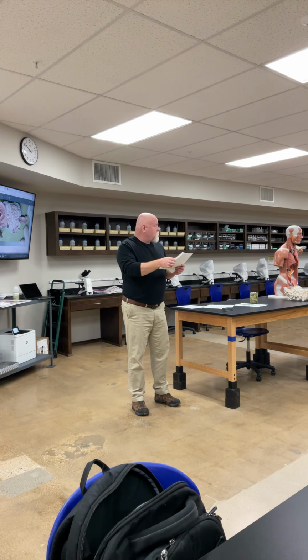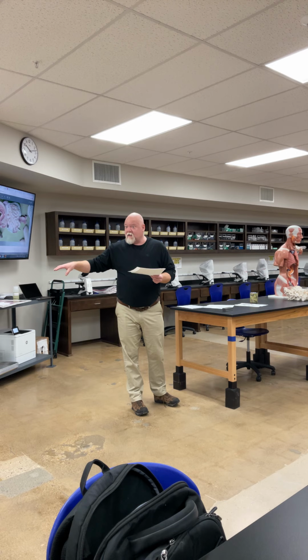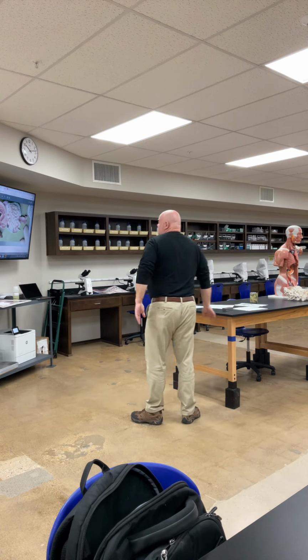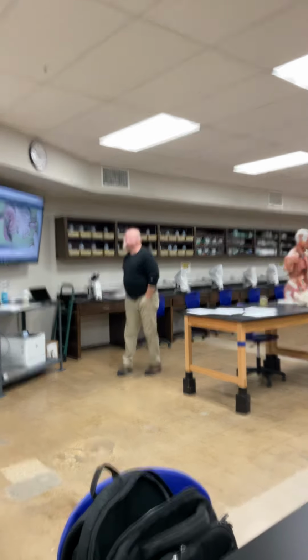And I'll put all this out. Then there's the liver slide, the pancreas slide. So those will be the slides, along with the lung slide and that trachea slide that we looked at last time, right? So we've got several slides on this one. Okay, so let's look at our model right quick. Let me take you through things right quick.